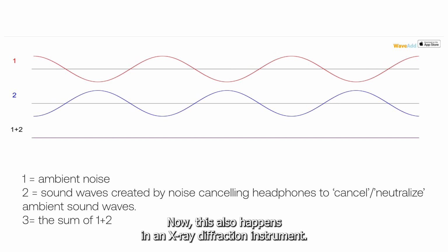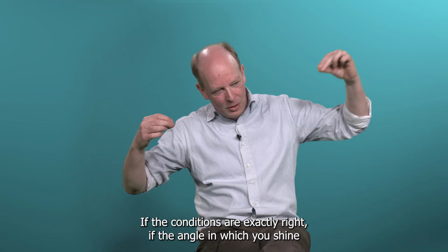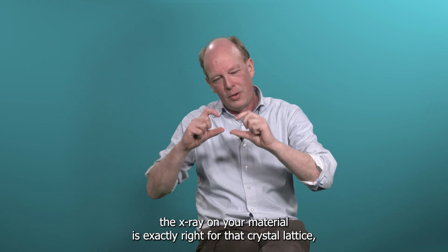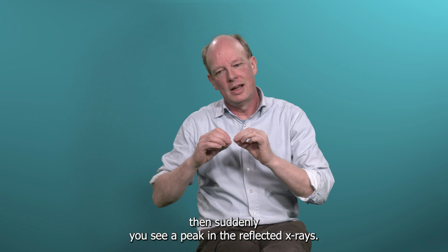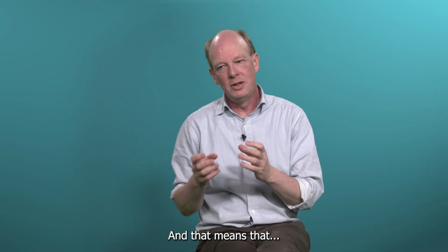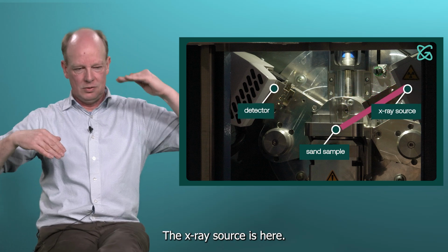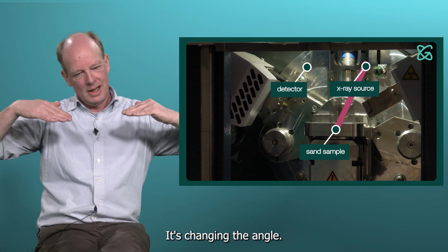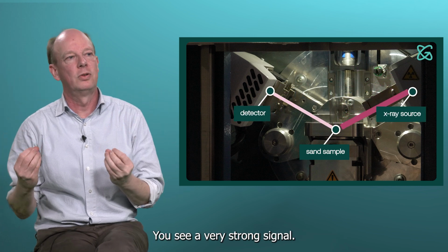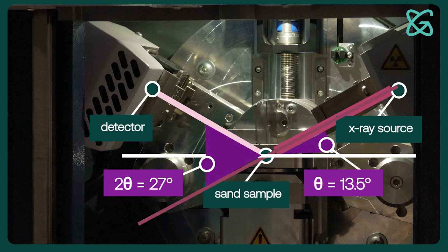Now, this also happens in an X-ray diffraction instrument. If the conditions are exactly right, if the angle in which you shine the X-ray on your material is exactly right for that crystal lattice, then suddenly you see a peak in the reflected X-rays. And that means that it's scanning across. What it's actually doing, the X-ray source is here and the detector is here. It's changing the angle, and suddenly at a certain angle you see, bang, you see a very strong signal. And that's what's showing us these peaks in this diffractogram.